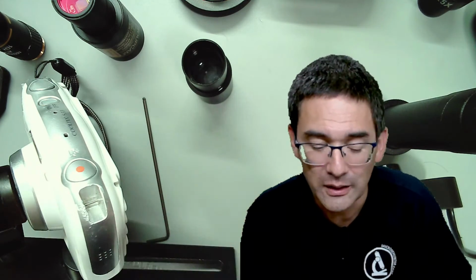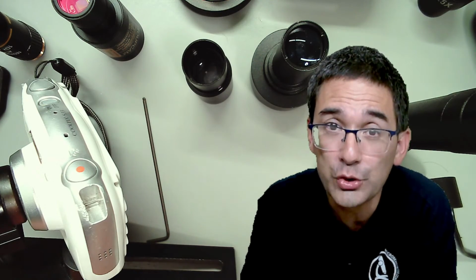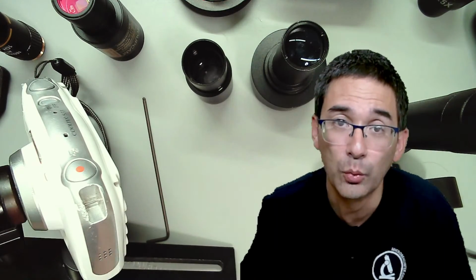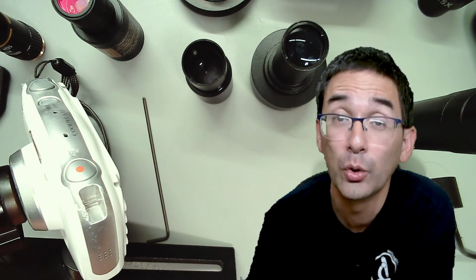Now, there are other ones as well these days that have very good microscopes. Euromex, for example, has very good microscopes and so on. What they sometimes do is they provide you with a complete adapter solution as well. So you don't have to try to find the pieces that work, but essentially you go to them and they provide you with a complete solution that should actually work out of the box.